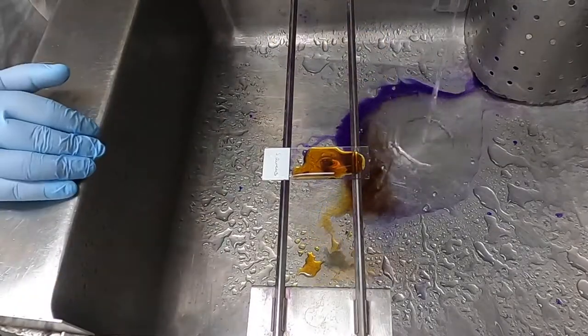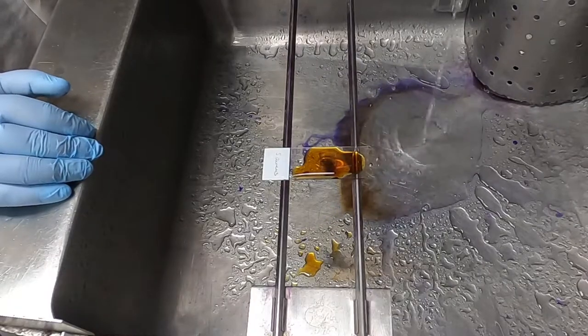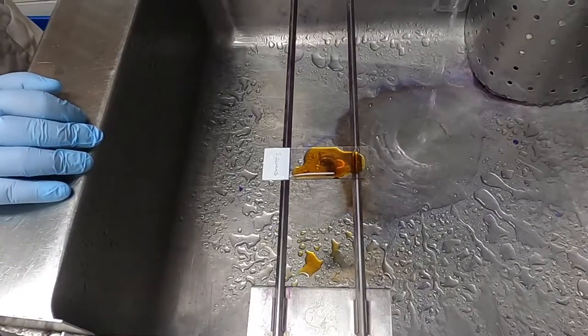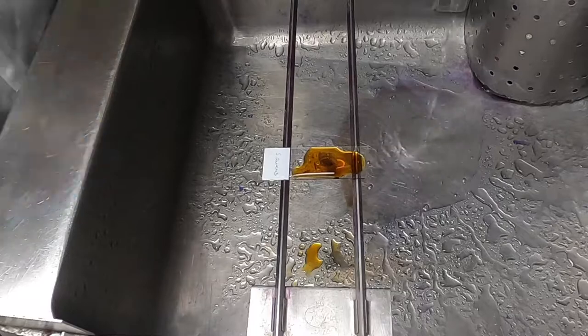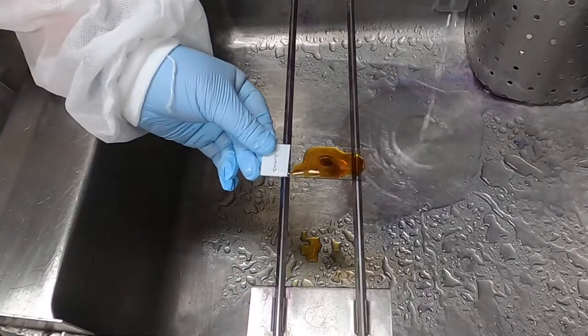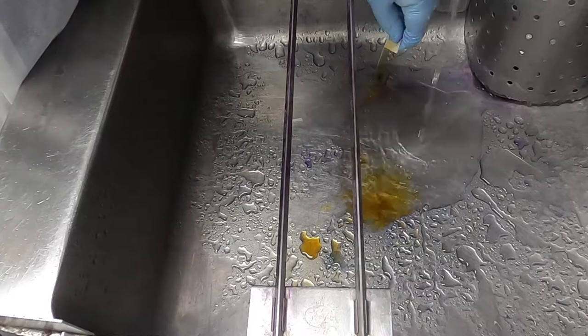Just like the crystal violet, we leave our Grams iodine on for one minute, incubating at room temperature and rinse in the sink as we did before.